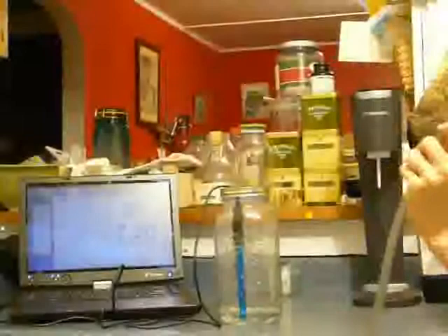And as you can see, we haven't had that much of a drop yet. It went down from 7.28 to 7.2, so it did go down a bit, but nothing like what we saw before. So let's see if I do this again, if I can get it to drop even more.